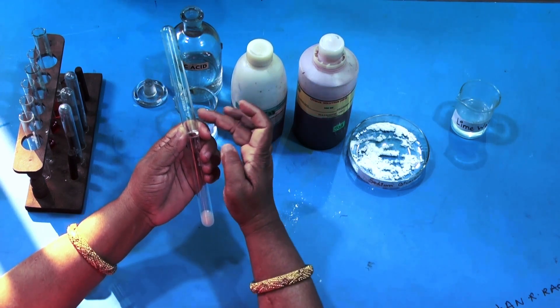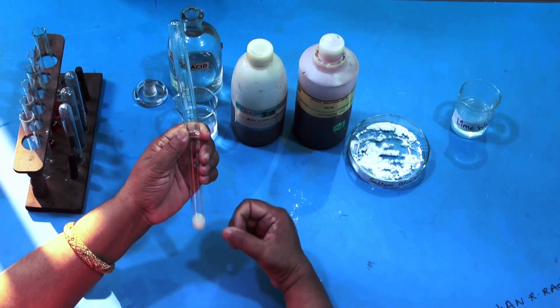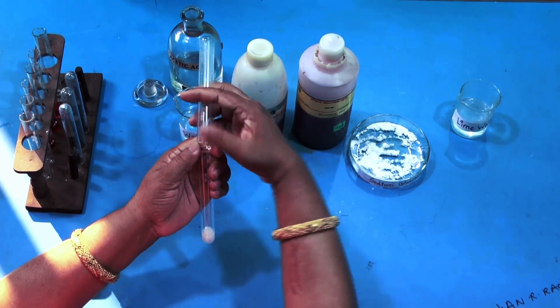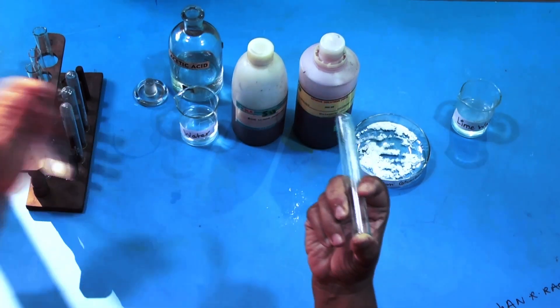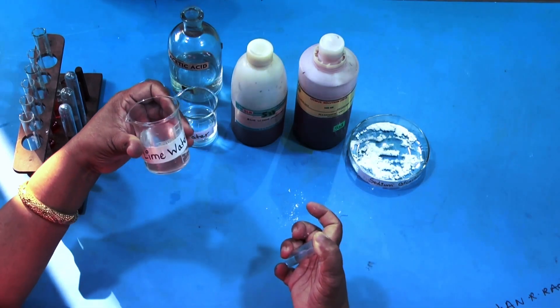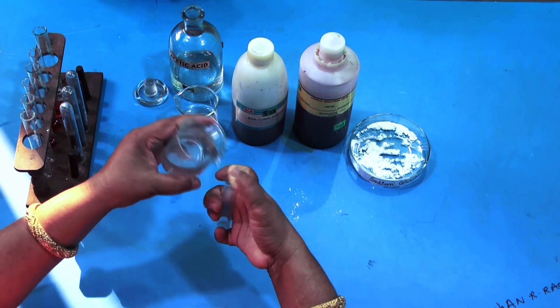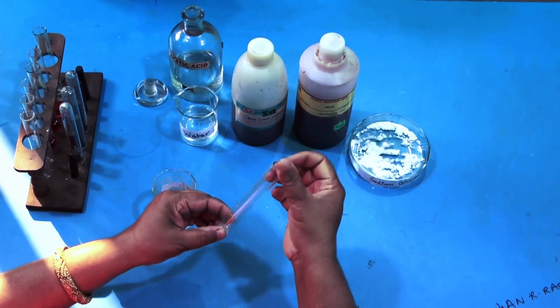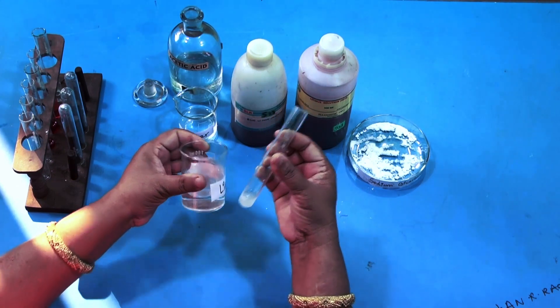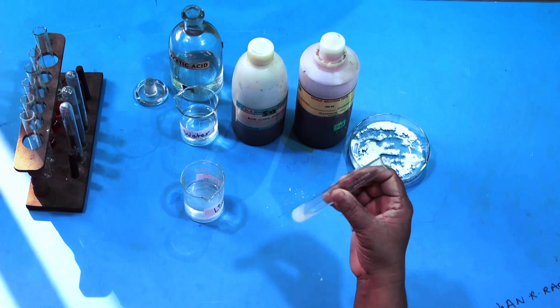The gas has been collected into this test tube — it is still giving out gas, you can see it very clearly children. Now I will be closing this test tube which contains carbon dioxide gas. Taking lime water — this is lime water, children, which is very clear as you can see — I am pouring it into the test tube where there is carbon dioxide gas and shaking it. You can see the solution has turned milky in colour. Lime water was clear but this solution has turned milky.